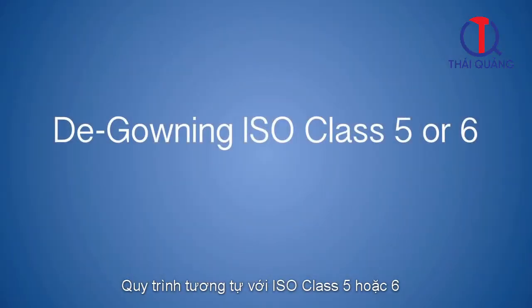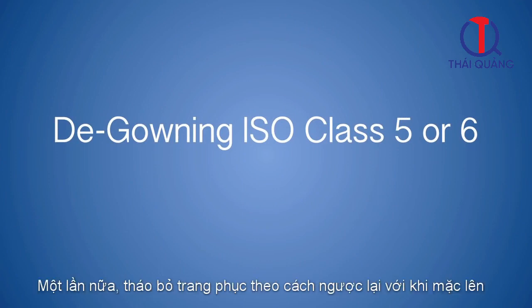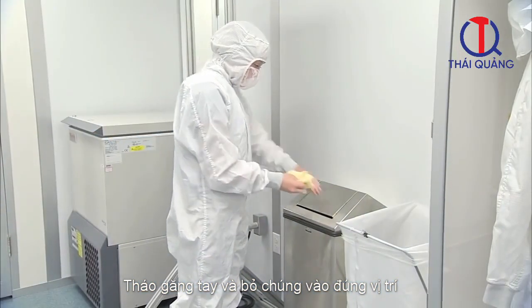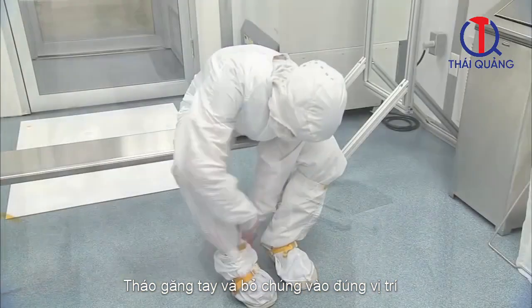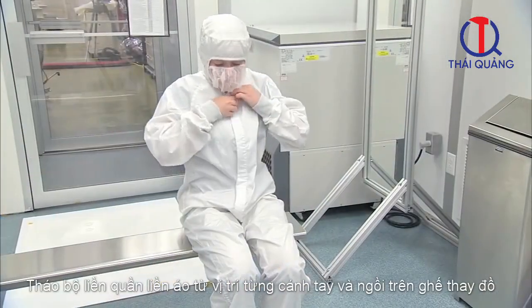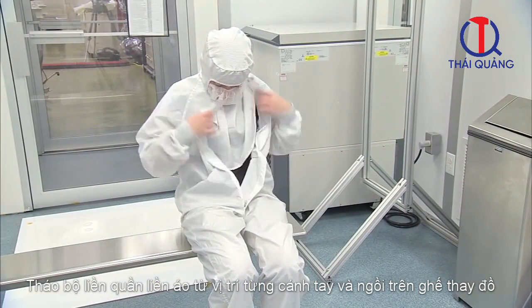The process is similar for an ISO Class 5 or 6 cleanroom. Once again, take off everything in the reverse order. Remove gloves and place them in the trash. Remove each cleanroom boot. Unzip the coveralls, remove the sleeves from your arms, and sit on the cleanroom bench.